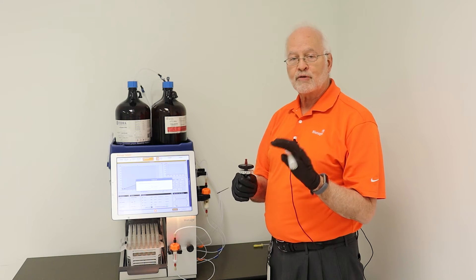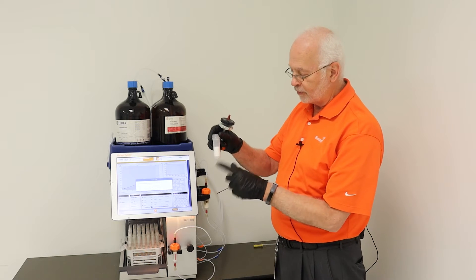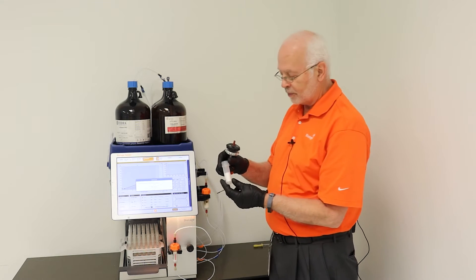And then take that dried material, pack it into an empty vessel like this. So this is just an empty version of this particular column here.